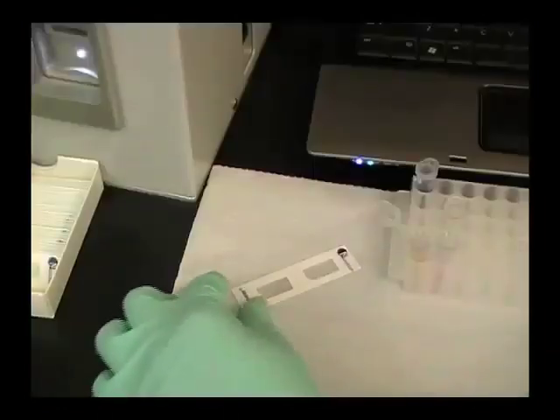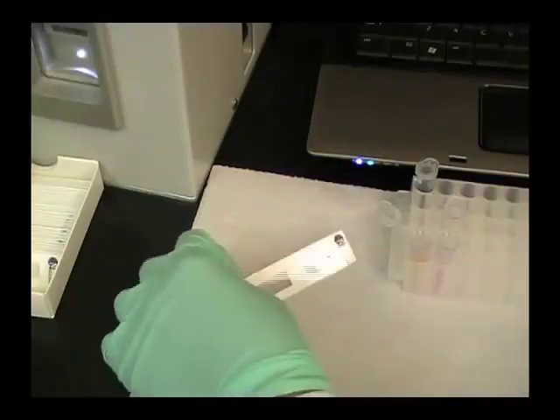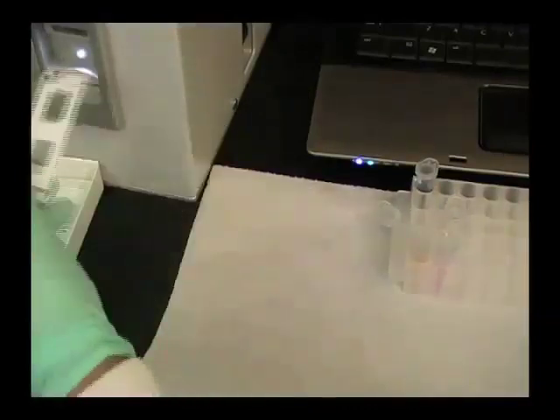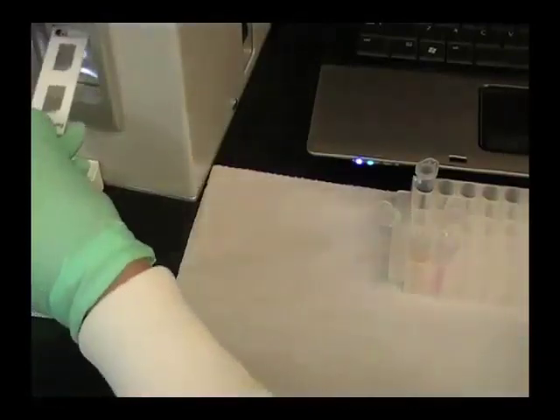Twenty microliters of stained PBMC are loaded into a Cellometer counting chamber, which is inserted into the Cellometer Vision instrument.